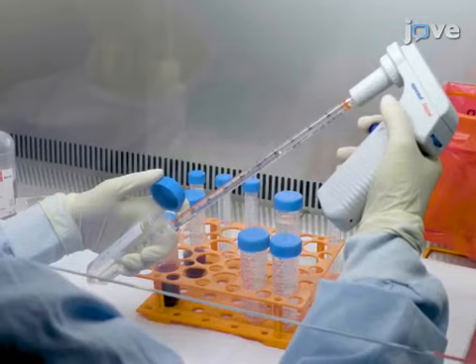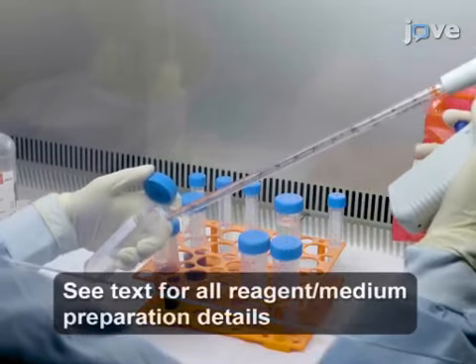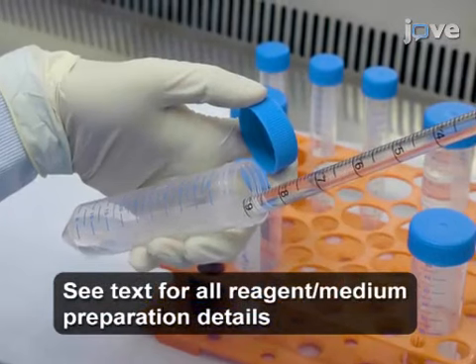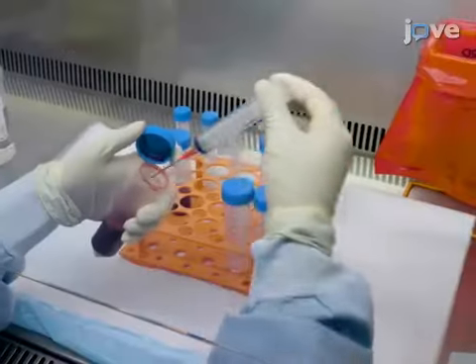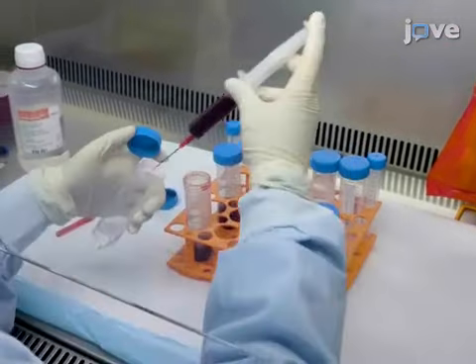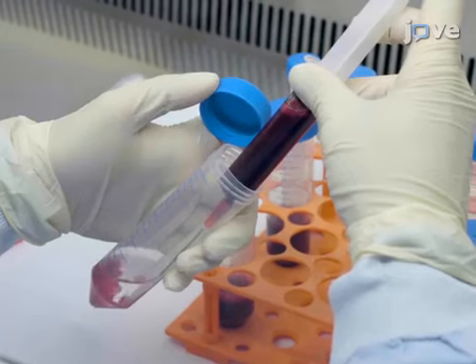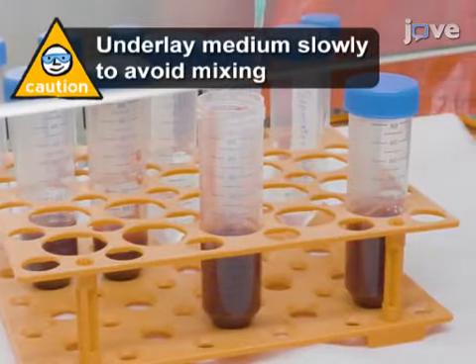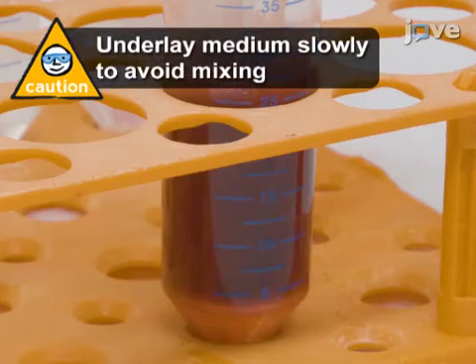Begin by adding 10 ml of separation buffer into one 50 ml conical tube per 10 ml of cord blood. Using an 18-gauge blunt needle mounted on a 10 ml syringe, transfer 10 ml of blood into each tube, followed by the addition of 15 ml of lymphocyte separation medium to the bottom of each tube.